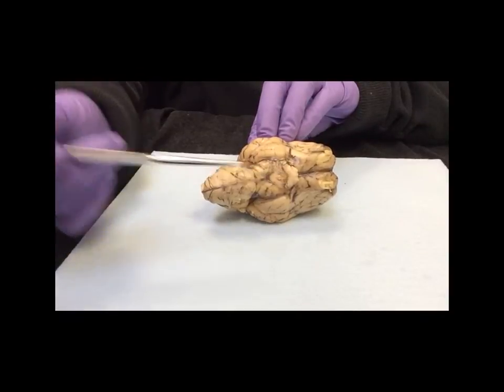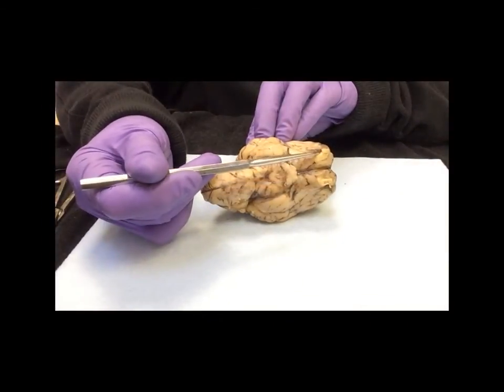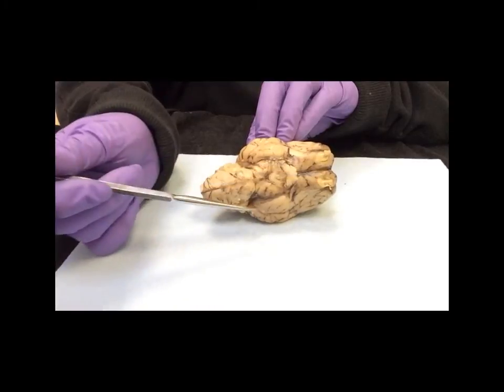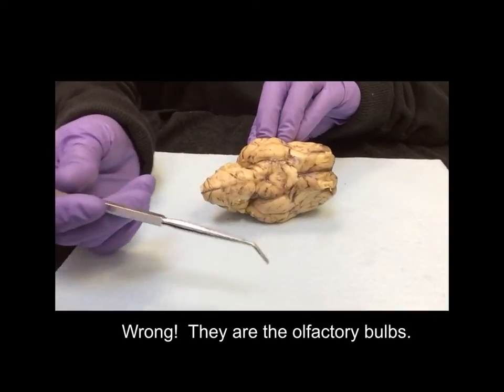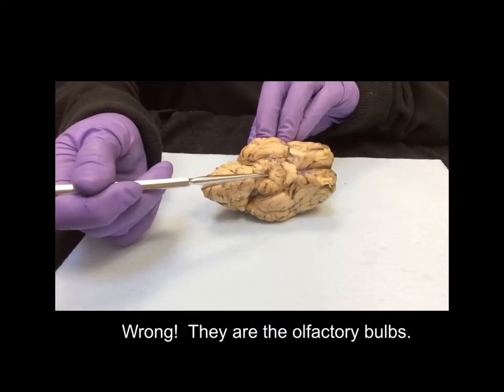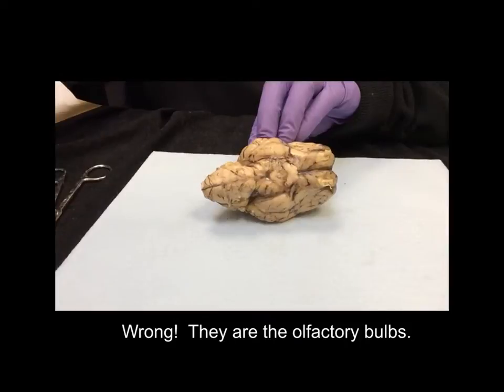The other structure you can clearly see here are these other nerves, which are called the olfactory bulbs, right there at the rostral end. And what you can't see here, because unfortunately we had to cut it off, but it would go right in there, is the infundibulum, which was connected to the pituitary gland.